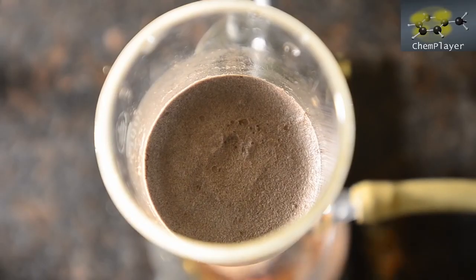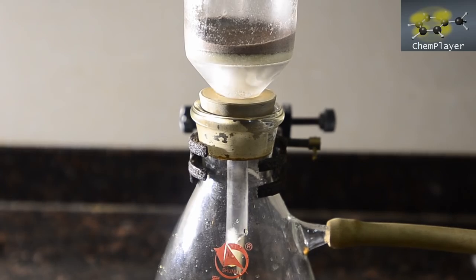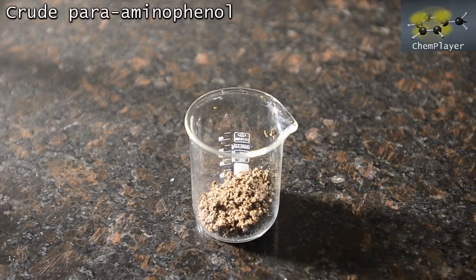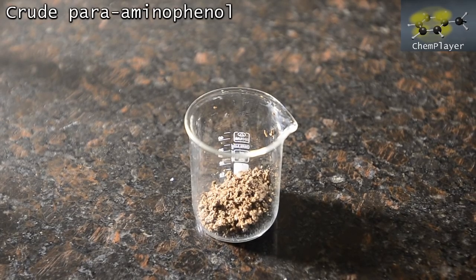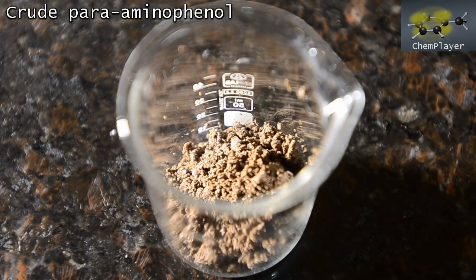And we get these as dry as we can. Okay, here's our crude product. We didn't bother to weigh it as it is still quite a brown color. The pure compound should be white, so this obviously has impurities and decomposition products in it.